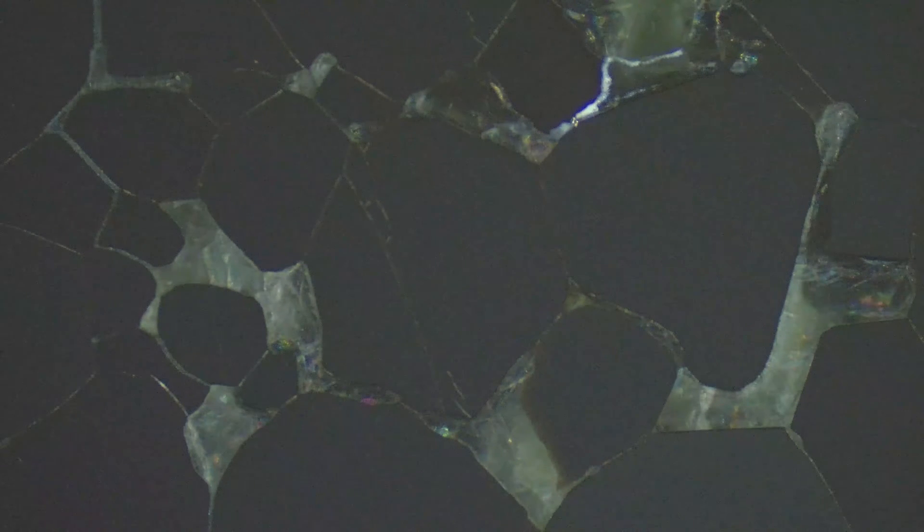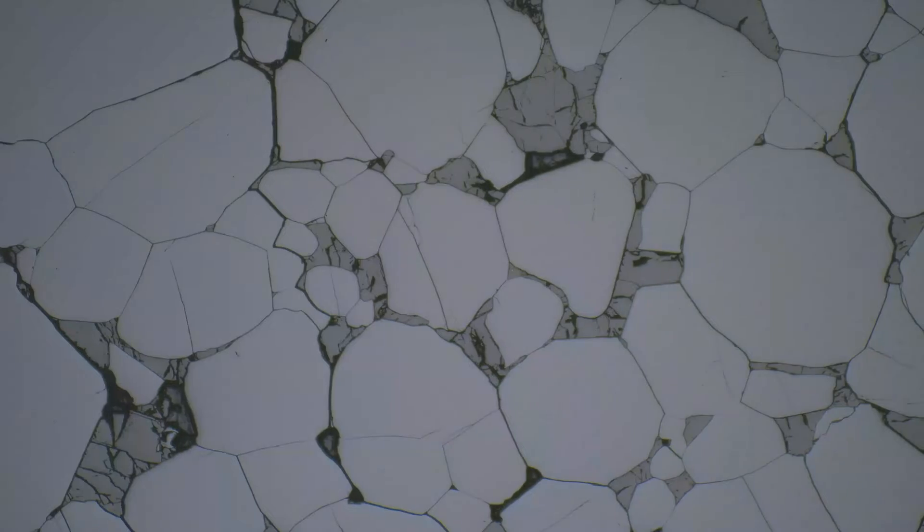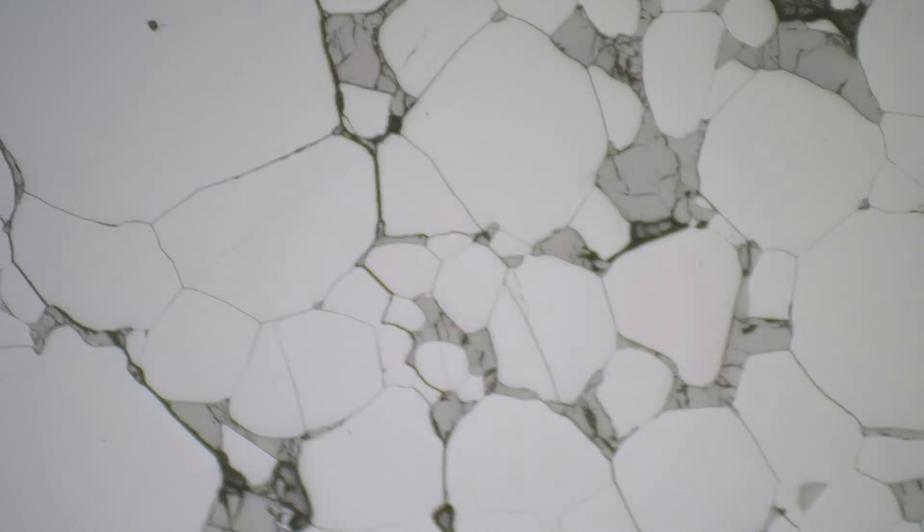As we rotate the slide and switch into cross-polars, we see that it is non-pleochroic — it's not changing color as we rotate the slide — and it's also isotropic, so we're not seeing very much reflectance in cross-polars or changes in color as we rotate the slide. We might see a little bit of brown internal reflections, maybe in the very central one, though it's not very distinctive, but that is something that can help us identify chromite in other slides.